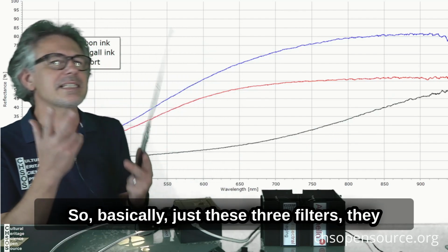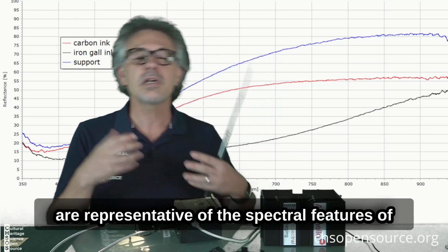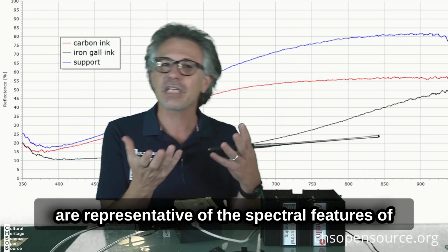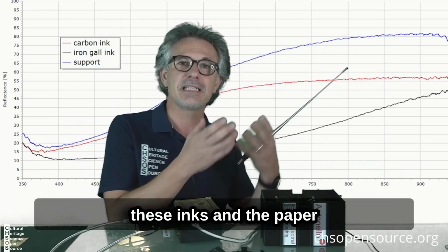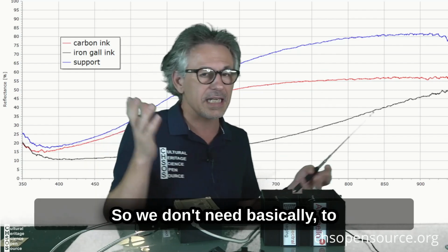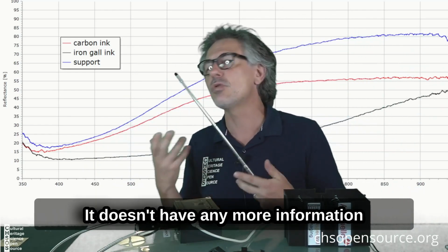So basically these three filters are representative of the spectral features of these inks and the paper. So we don't need to apply all the other filters. It doesn't add any more information.